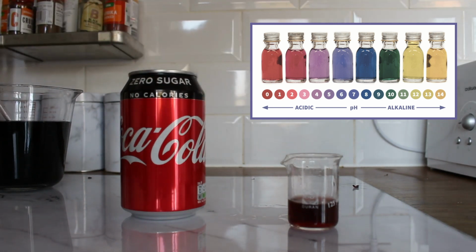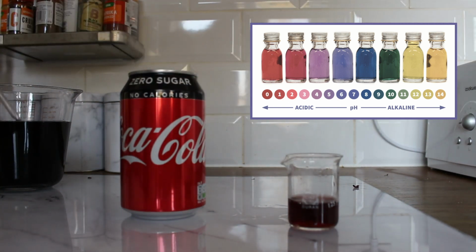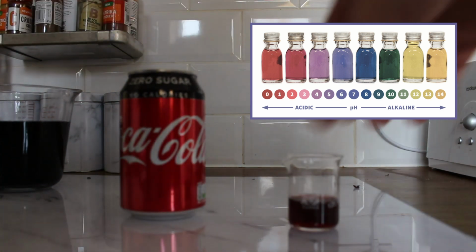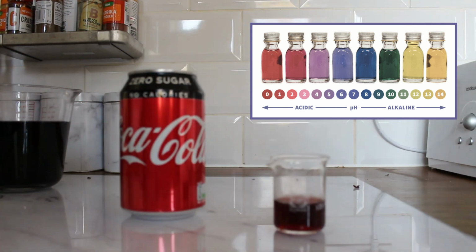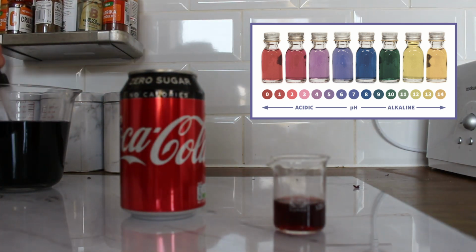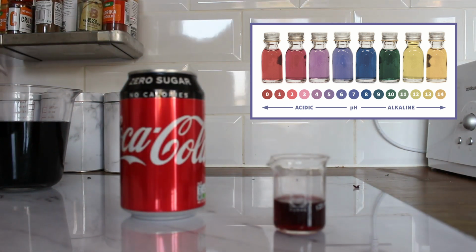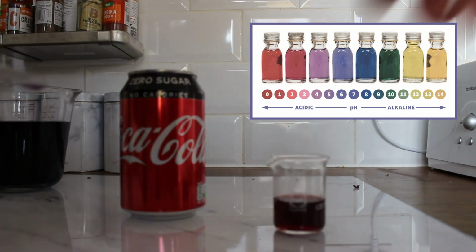And I think this is probably one of my favourite reactions that I'm going to show you today because the result is quite surprising. I'm going to shake the beaker around in a moment and you should be able to see what colour it goes. So hopefully you can see that it's gone a little bit red here. It's quite a dark red, so this means that Coke is really acidic. The reason it's acidic is because it contains something called phosphoric acid, and that helps give Coke its tangy taste.